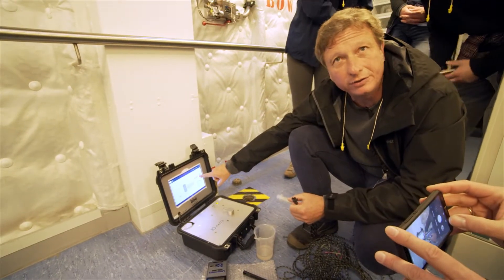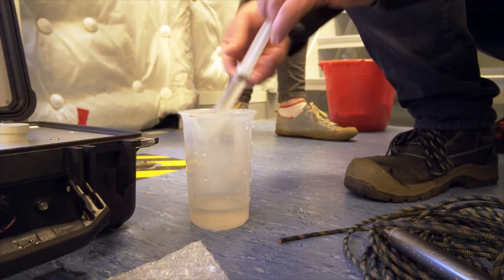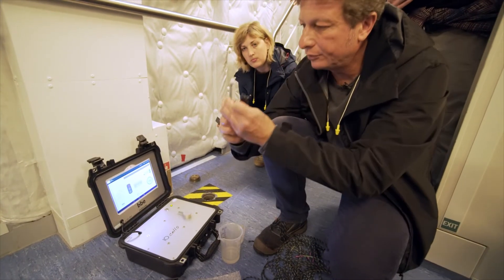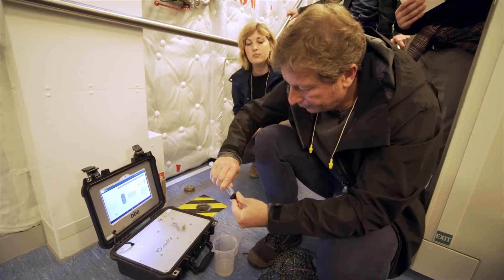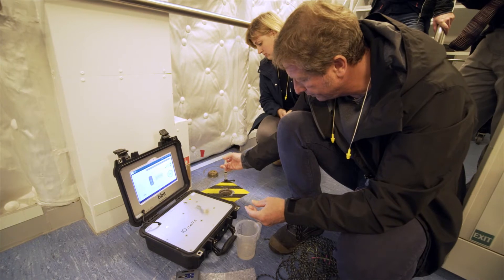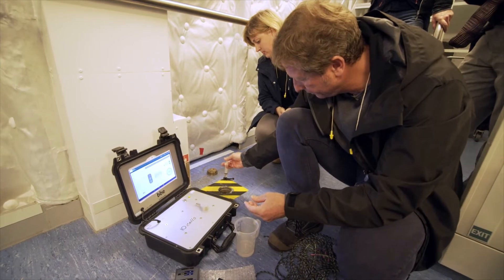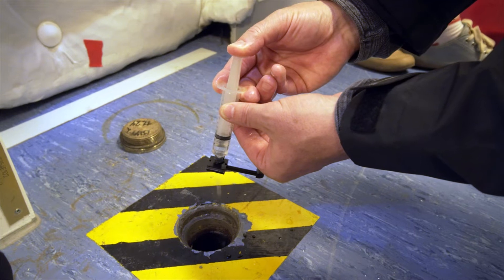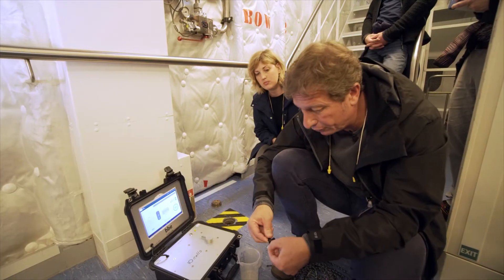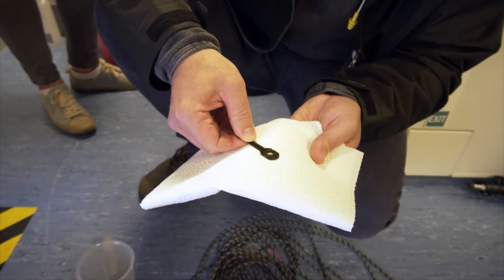This is now set up for a 10 milliliter check measurement, so you need 10 milliliters. I go to 10 ml, put some air in, connect it and pour this out. I drop it back in the tank. This is an 8 micron filter, so organisms smaller than 8 microns — which may be many — are supposed to not be large enough to influence the measurement.